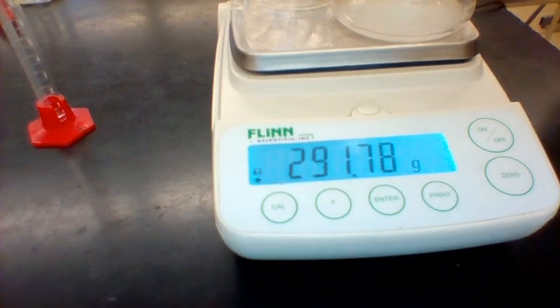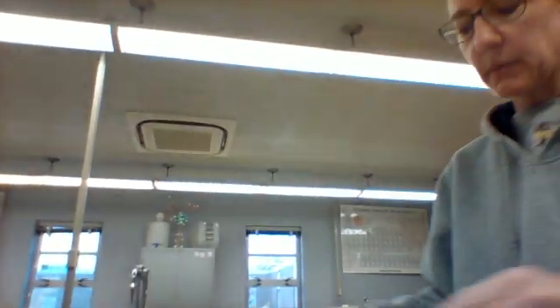That should make sense: our mass is fairly close, but when we left that stopper off, we had a huge amount of gas that escaped into the air. Remember that gas has mass, and so that's where the missing mass went, as it escaped with that gas.